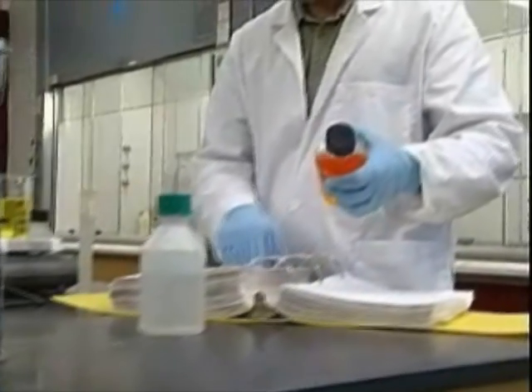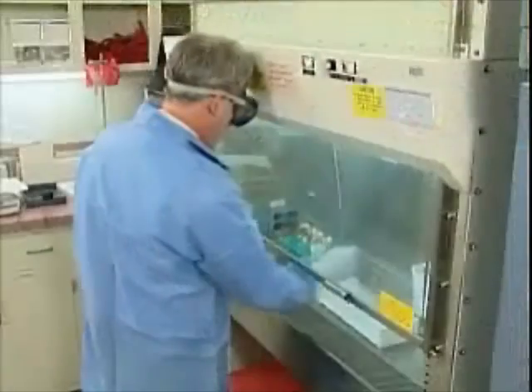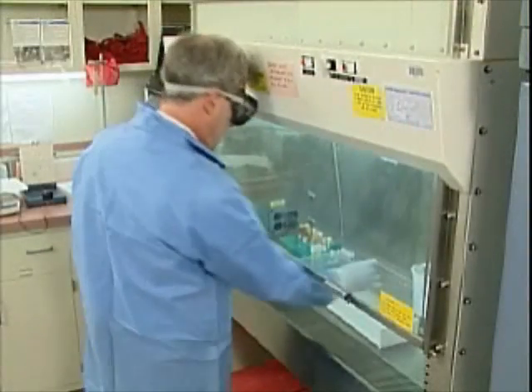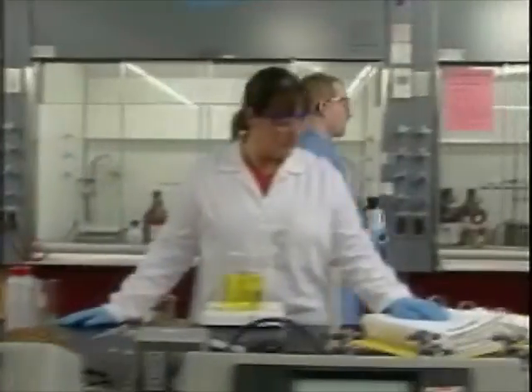Handling things like hazardous chemicals or specimens requires a great deal of caution. If we don't contain them, hazards can spread and contaminate the things around them, including you and your coworkers.